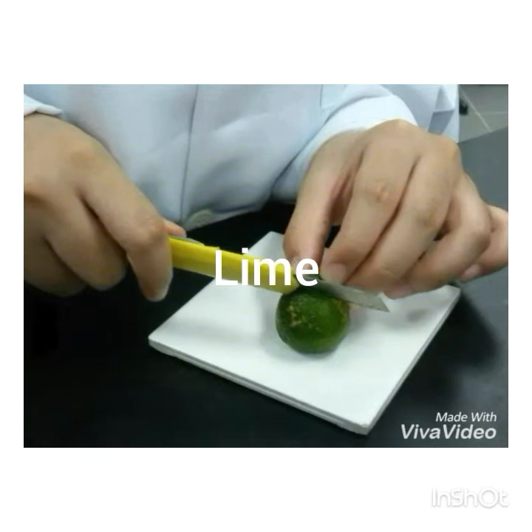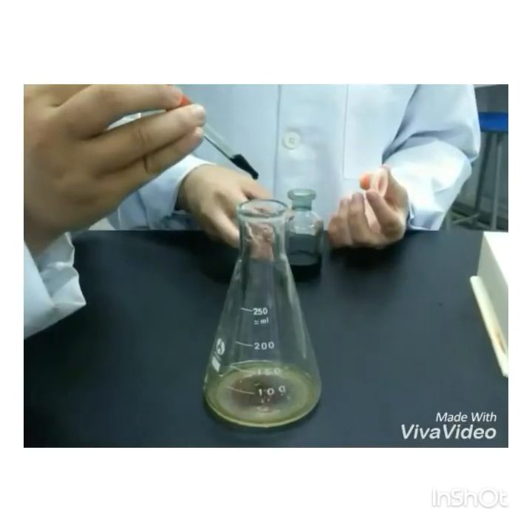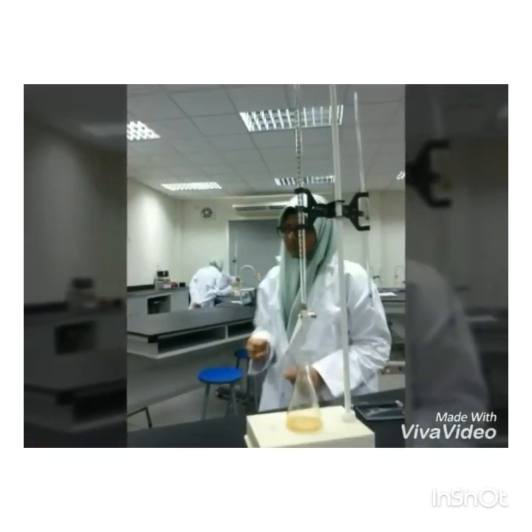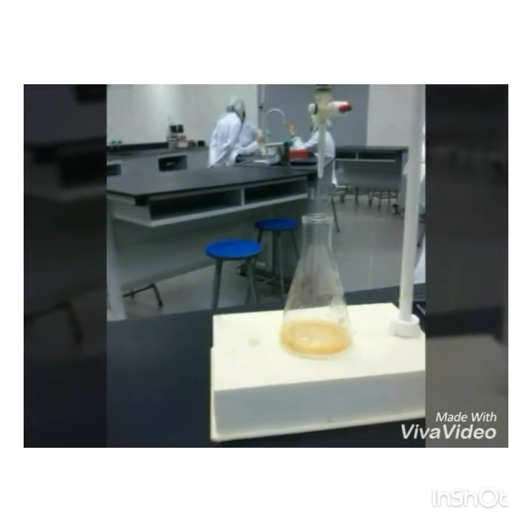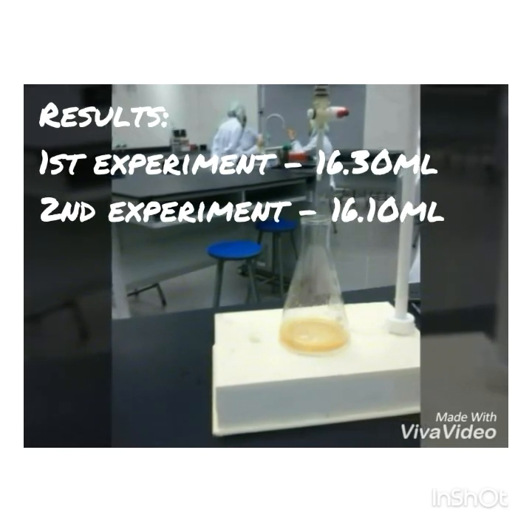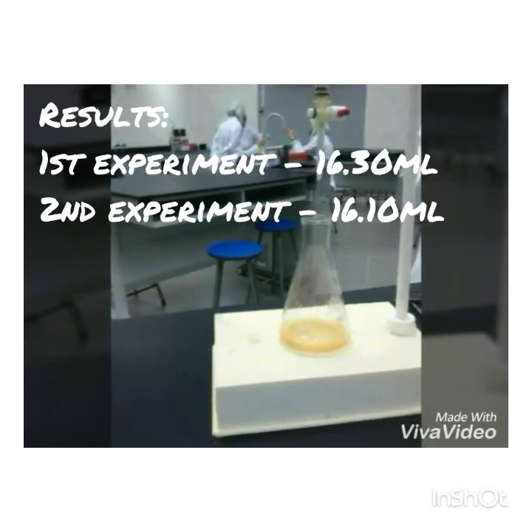Our third sample to test out is lime. For lime, we also used the same amount of juice as the previous ones. Next, we added the same number of indicator as well. We even followed the same process as for the lemon and the orange. We added the sodium hydroxide until the lime juice turned to orange color. The reading for the first time for sodium hydroxide used is 16.30 milliliters. And the reading for the second time of the sodium hydroxide, of course, is 16.10 milliliters.